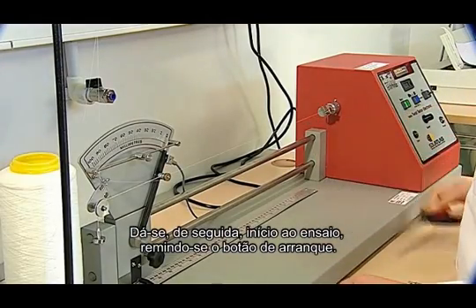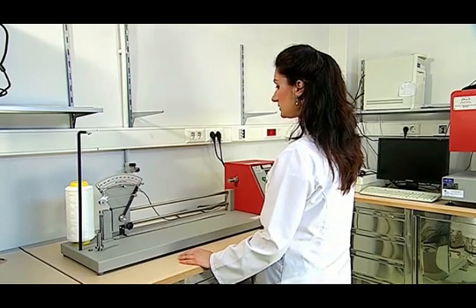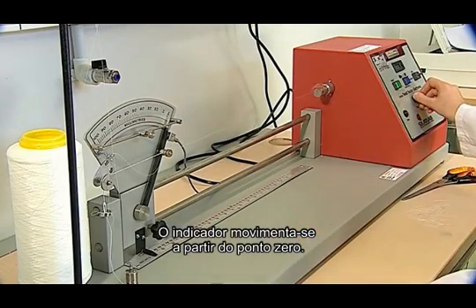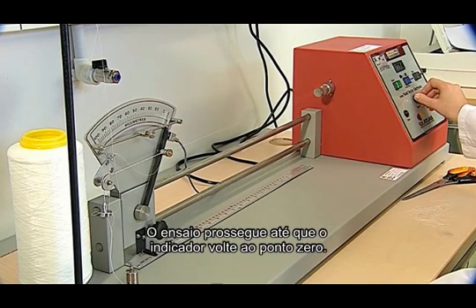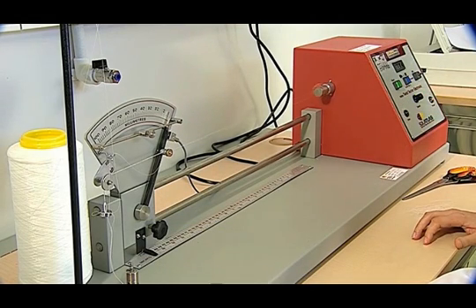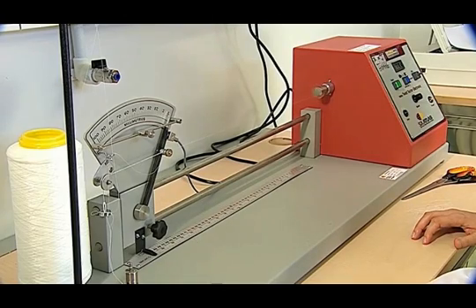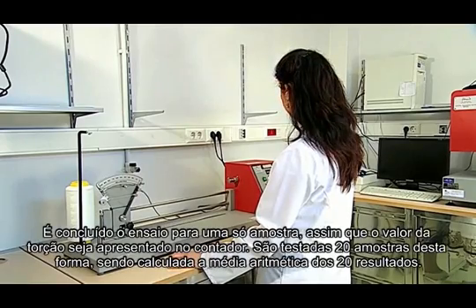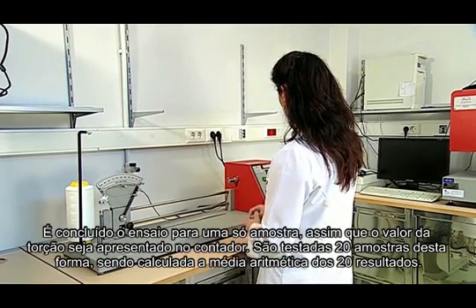Then, the test is started by pressing the start button. The pointer begins to move from the zero point. The test is carried on until the pointer returns to the zero point again. The device automatically stops when the pointer comes to the zero point. The test for a single sample is completed once the value of the twist from the counter is obtained.